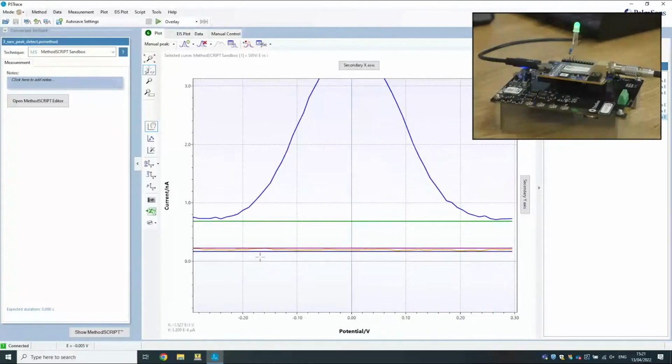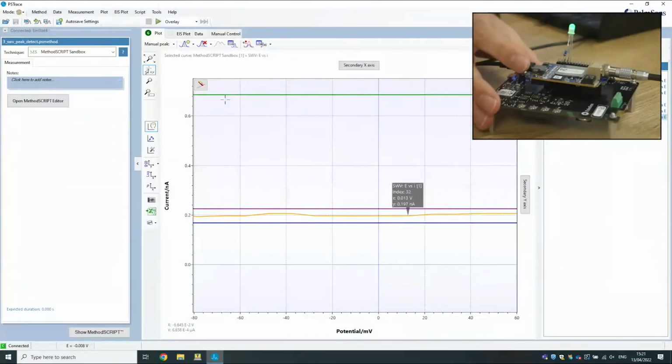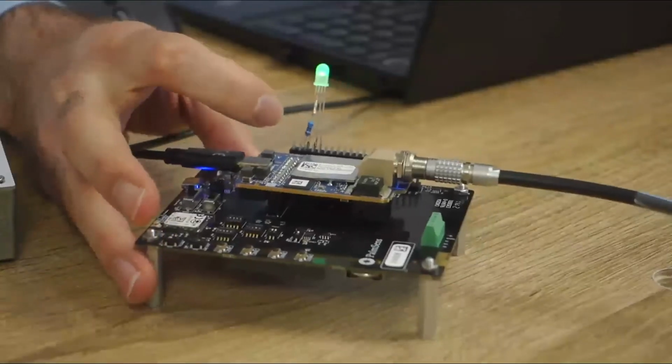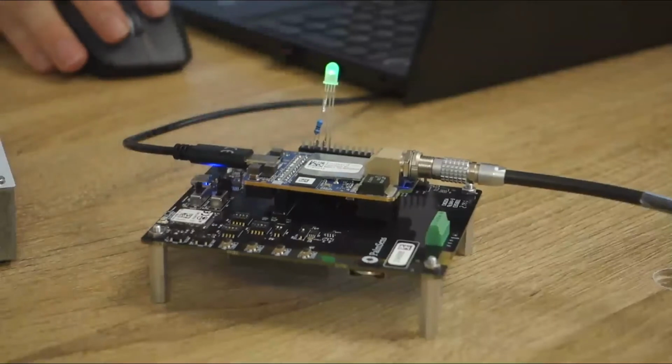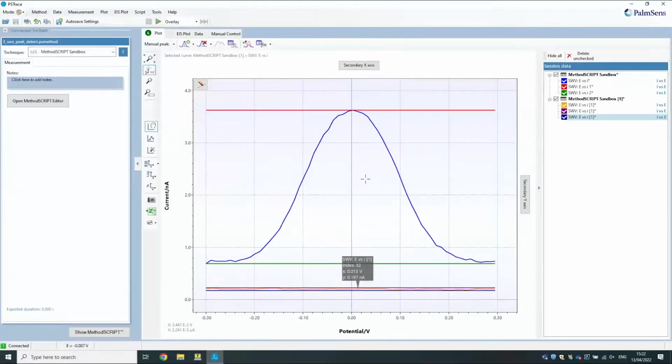And this is the new measurement. You can see it's mostly a constant current, and the peak value is definitely not higher than 2 nanoamps. And so we can see here that the LED has gone green, indicating that we haven't detected a peak. Okay, that's all for this example.